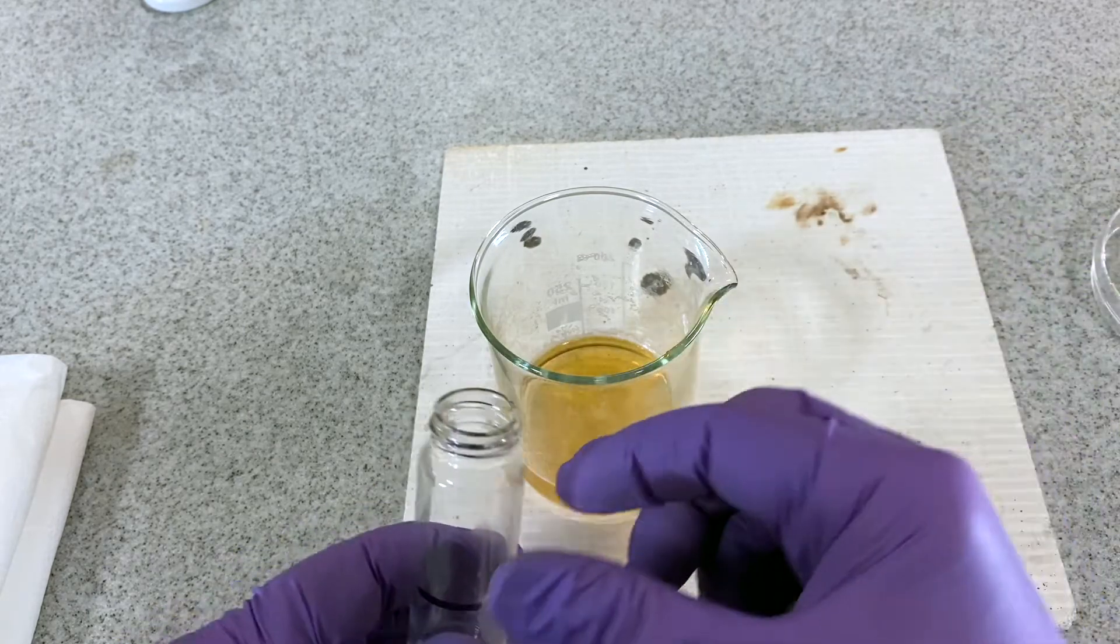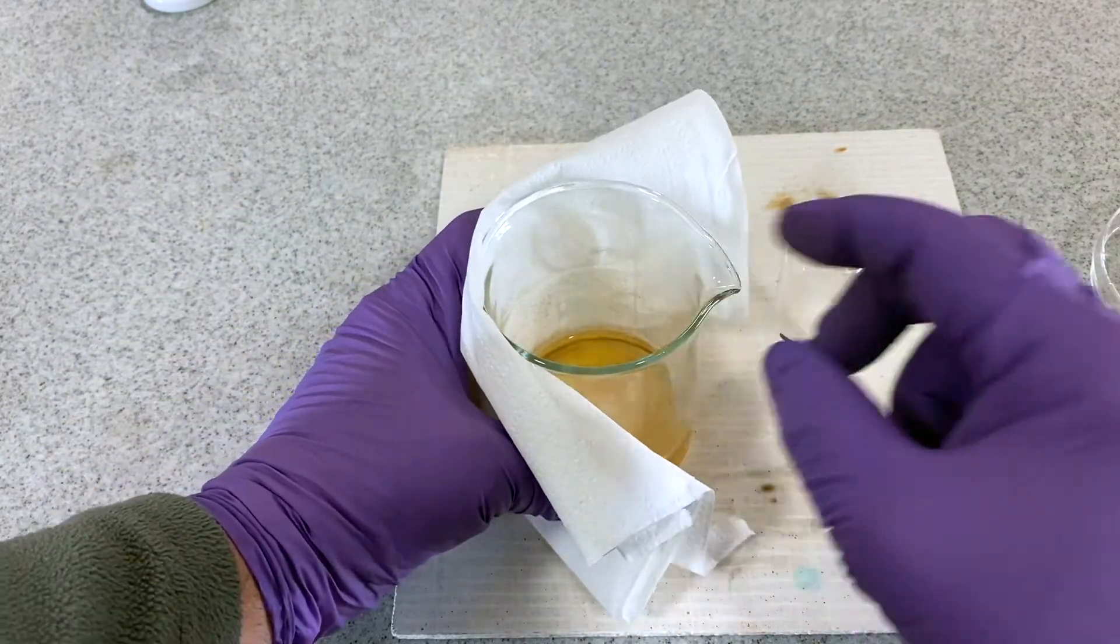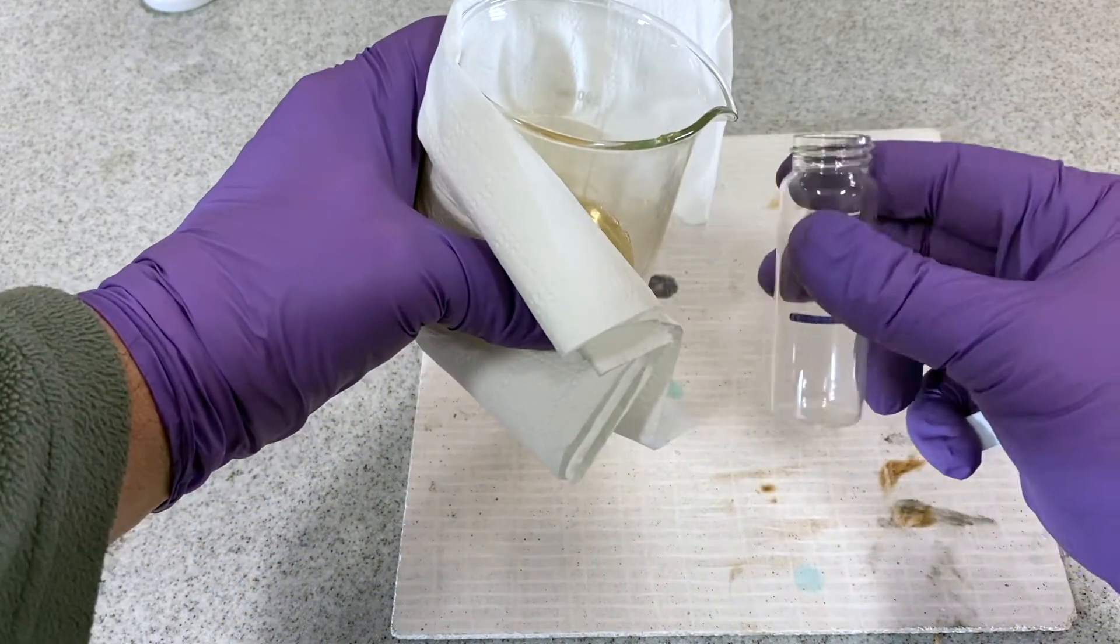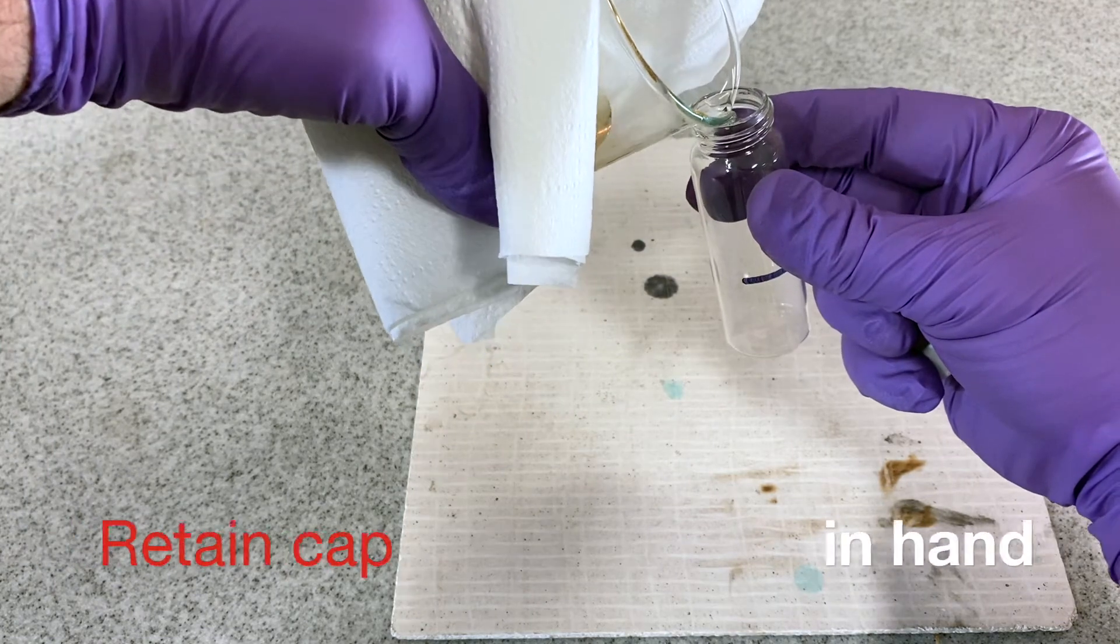Allow the beaker and its contents to cool for a few moments on top of the tripod before removing. At this point the beaker can be safely handled using a pad of gauze or some tissue paper.